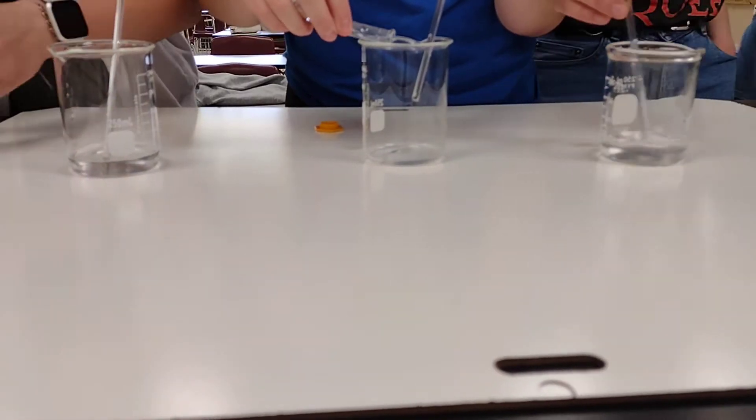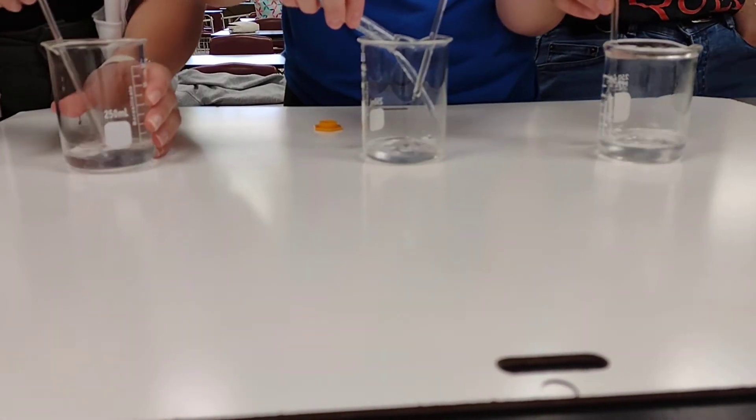Okay, and then next we're going to dump in the other two simultaneously and then stir, so hang on. Are you supposed to stir it right now? Yep, you're okay, just mix it in a little.